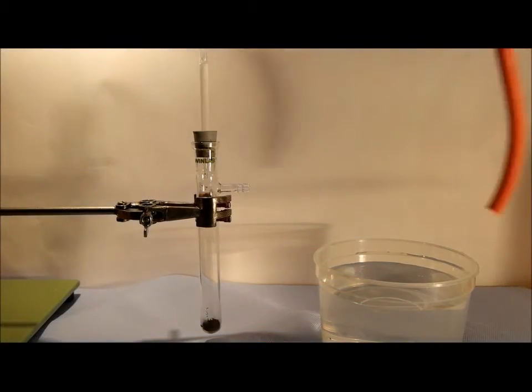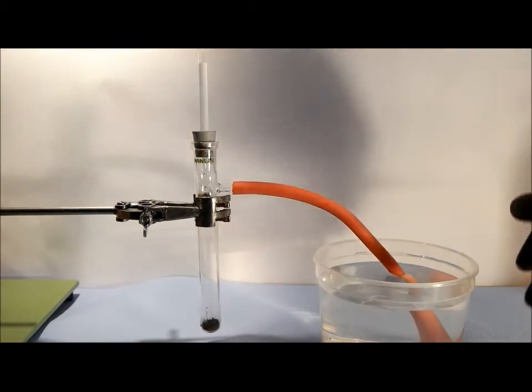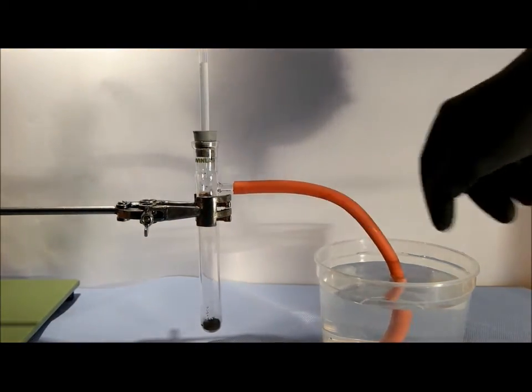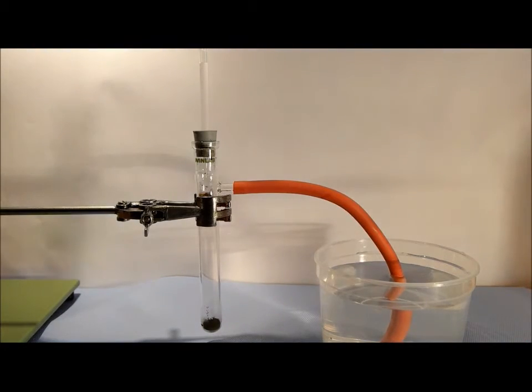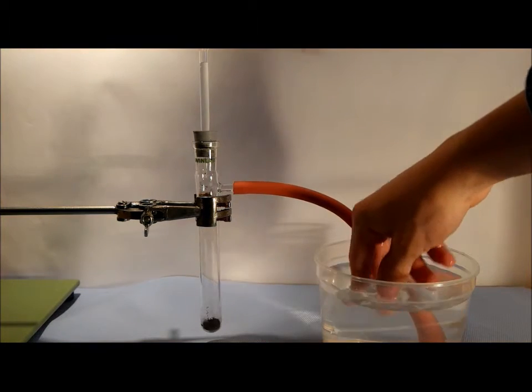Now put a tube on your test tube and put it in a beaker with some water and with another test tube in it. Here we will catch the oxygen later.